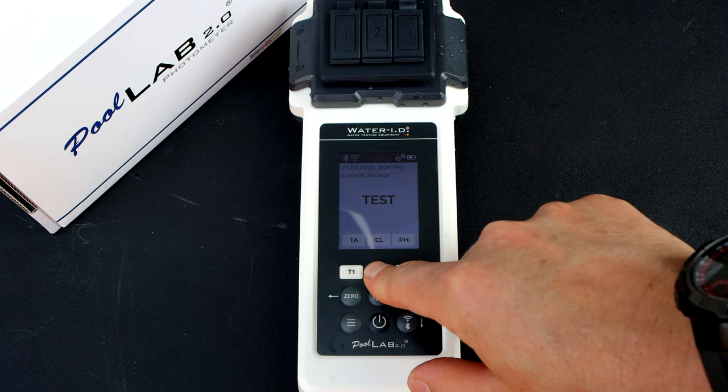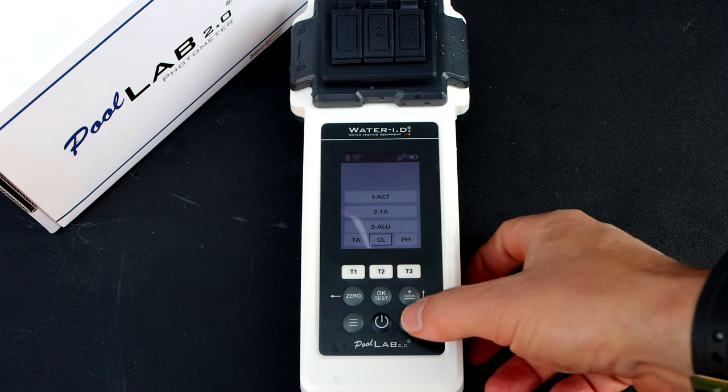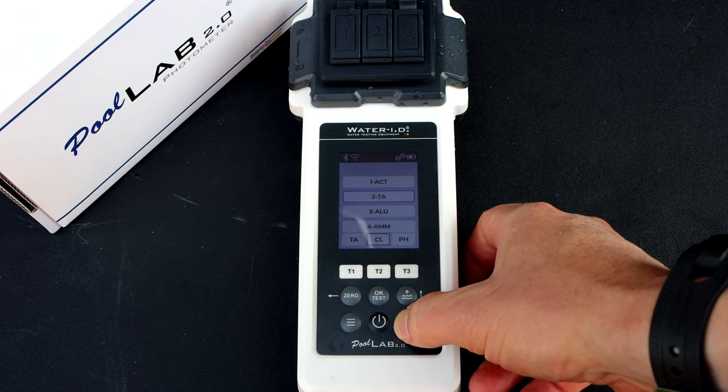I've got the cyanuric acid tablet. When you're doing a single test factor, you want to use the middle chamber.